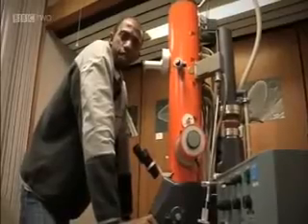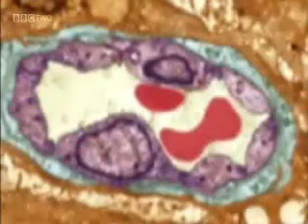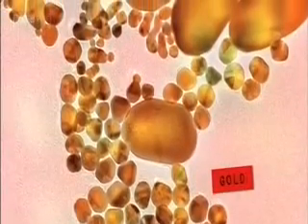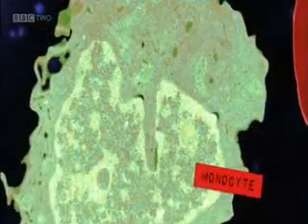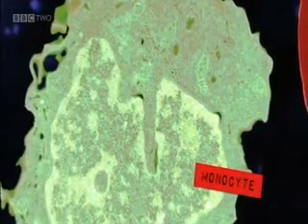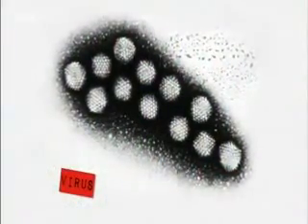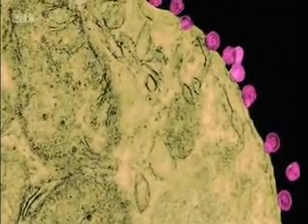But what about a transmission electron microscope? The difference with a transmission electron microscope is that it sees through things. It does this by sending beams of electrons rather than light through ultra-thin specimens. Using these microscopes, we're able to study the interior of cells and their organelles, and we've been able to get a better understanding of how pathogens, such as viruses, invade cells — like these HIV particles budding on the surface of a T cell.